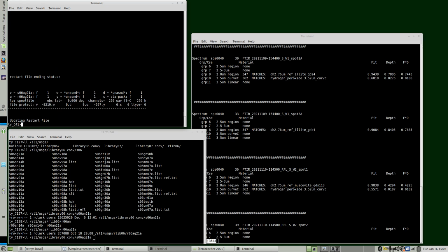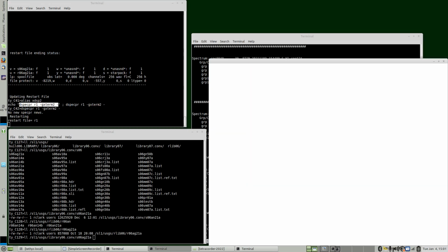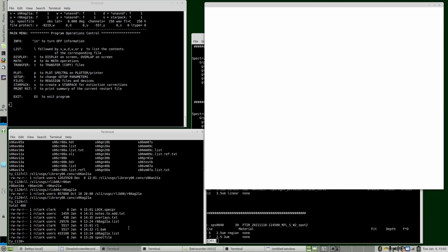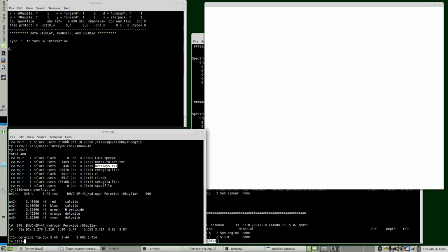I'm going to exit and restart with my alias. So we're going to restart with this command, the restart file, graphics terminal size 2, and skip the intro. Okay, so now we're set up. We can look at spectra. Now, to make this video a little easier, I've set up some notes here. So we'll go to the display routine.